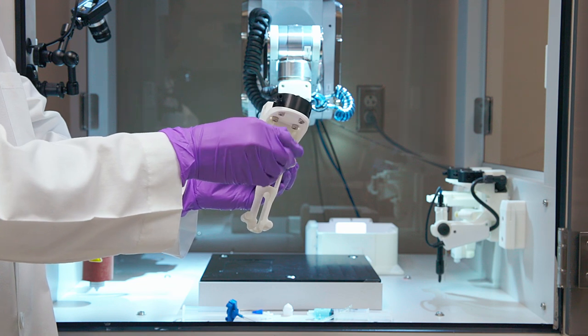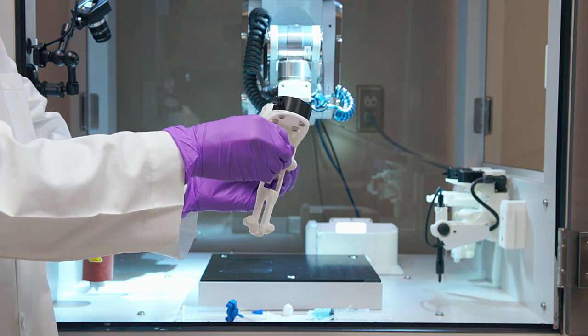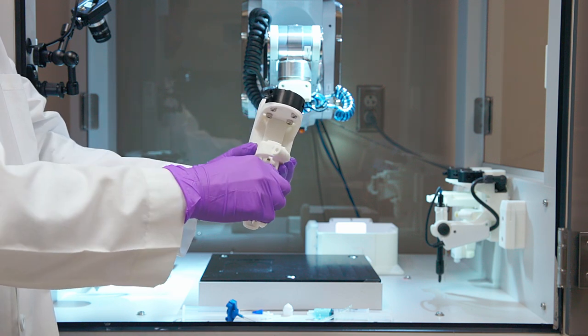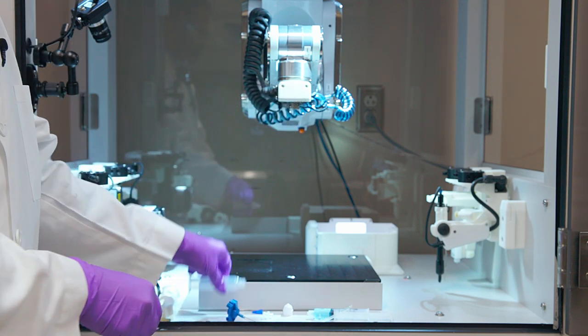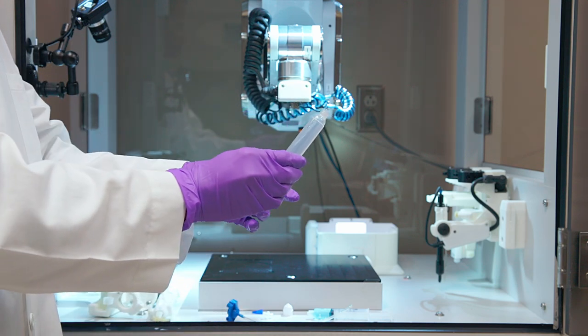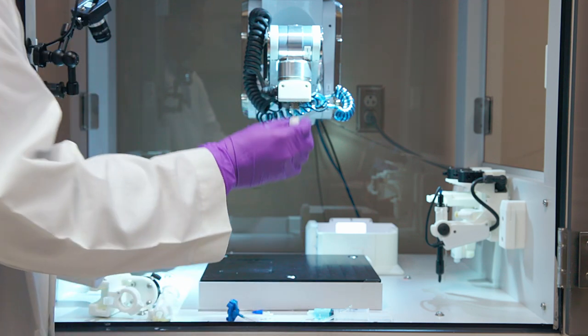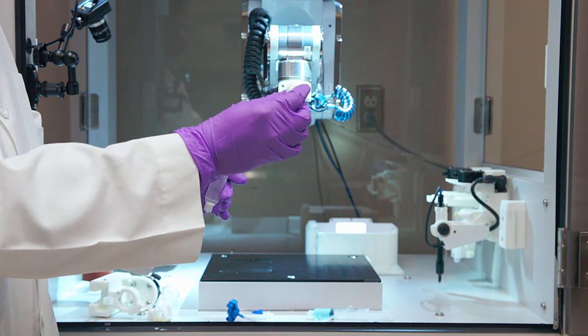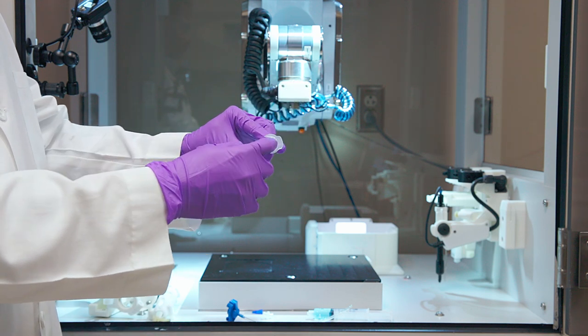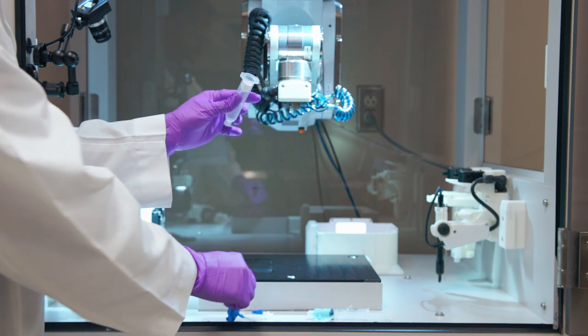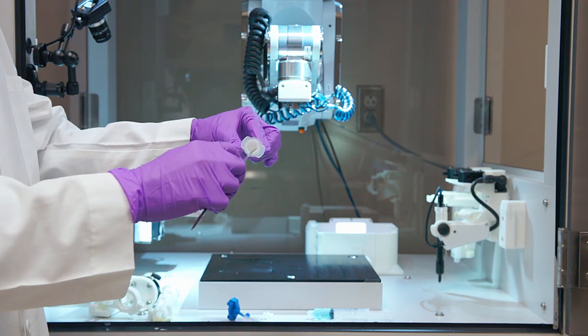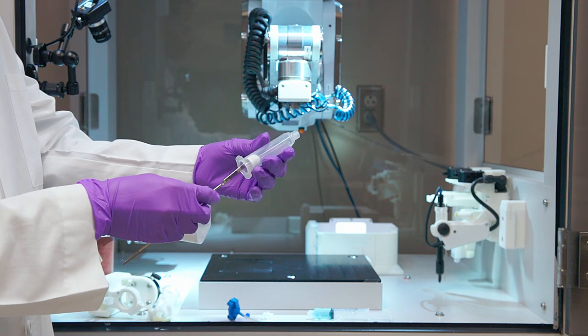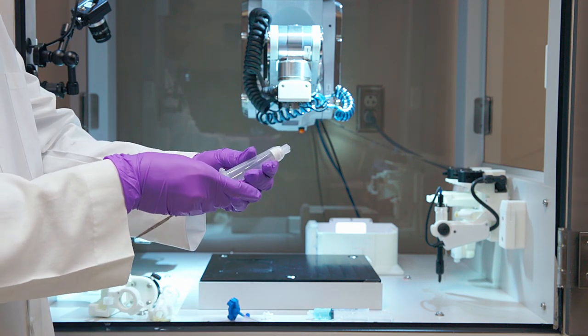Before installing the syringe into the adapter, we will prepare the syringe with our material. This is a 10 cc syringe, and this is a piston. Insert the piston into the broader end of the syringe, and using a blunt spatula, push the piston all the way to the end.